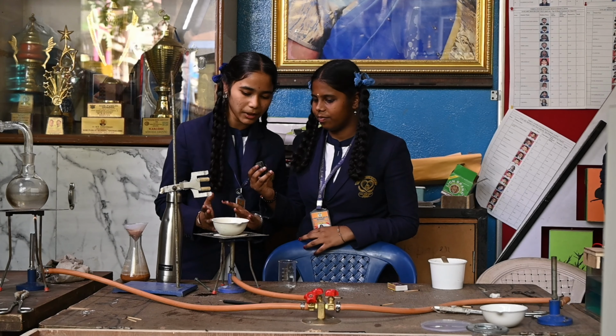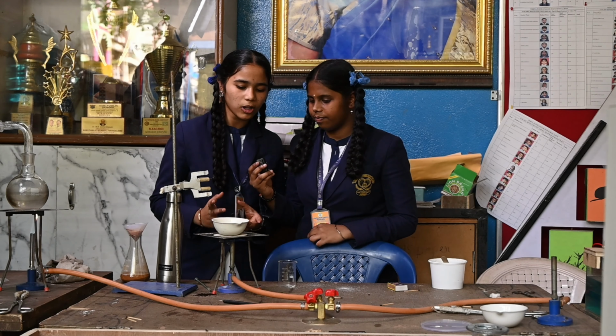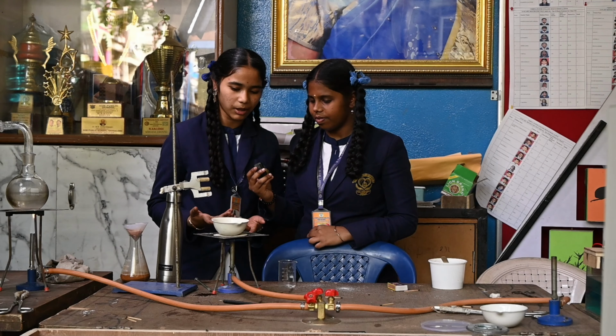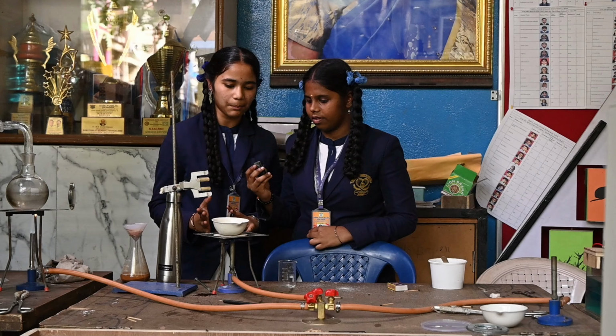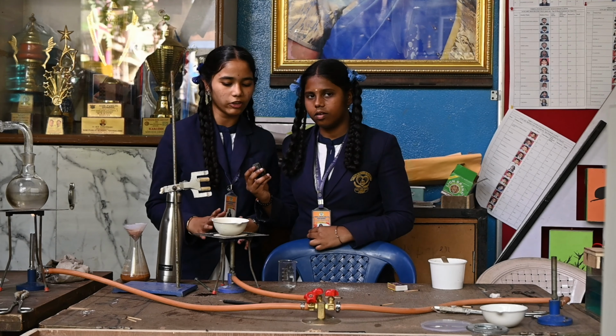After separating the sand from the salt water, all the salt water will turn into vapor and go out through vaporization. The evaporation process will take place and finally the salt will be formed.